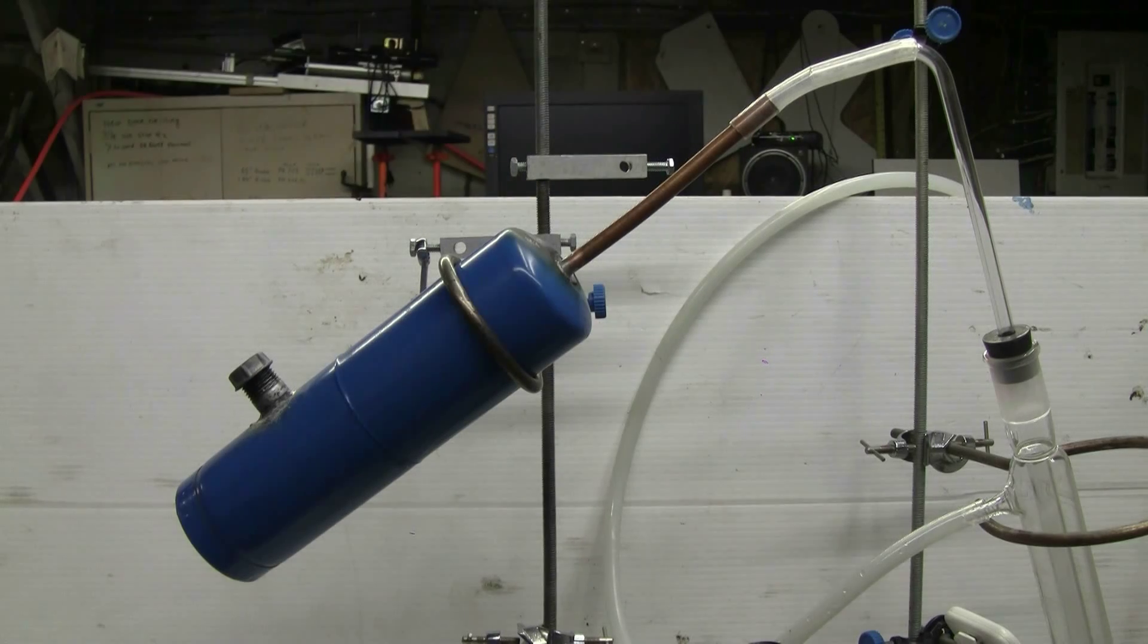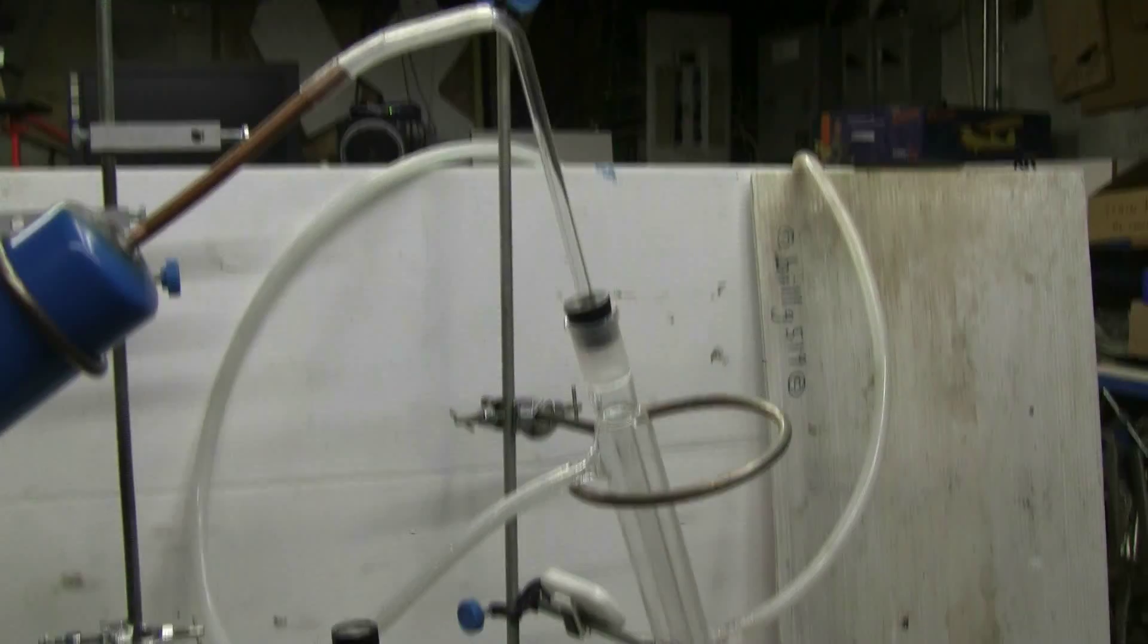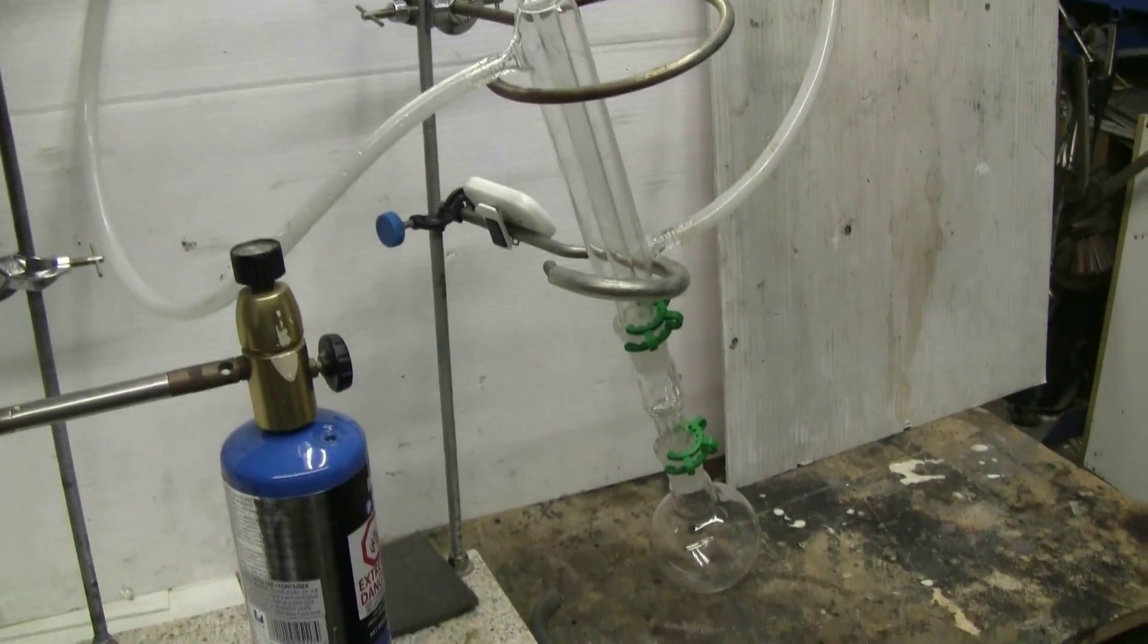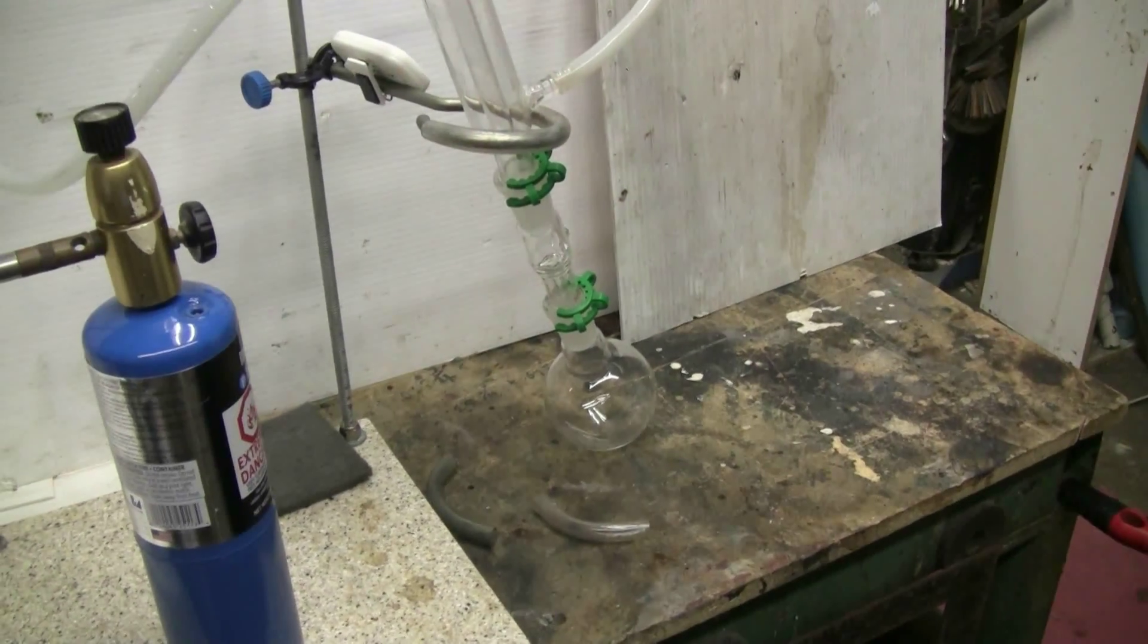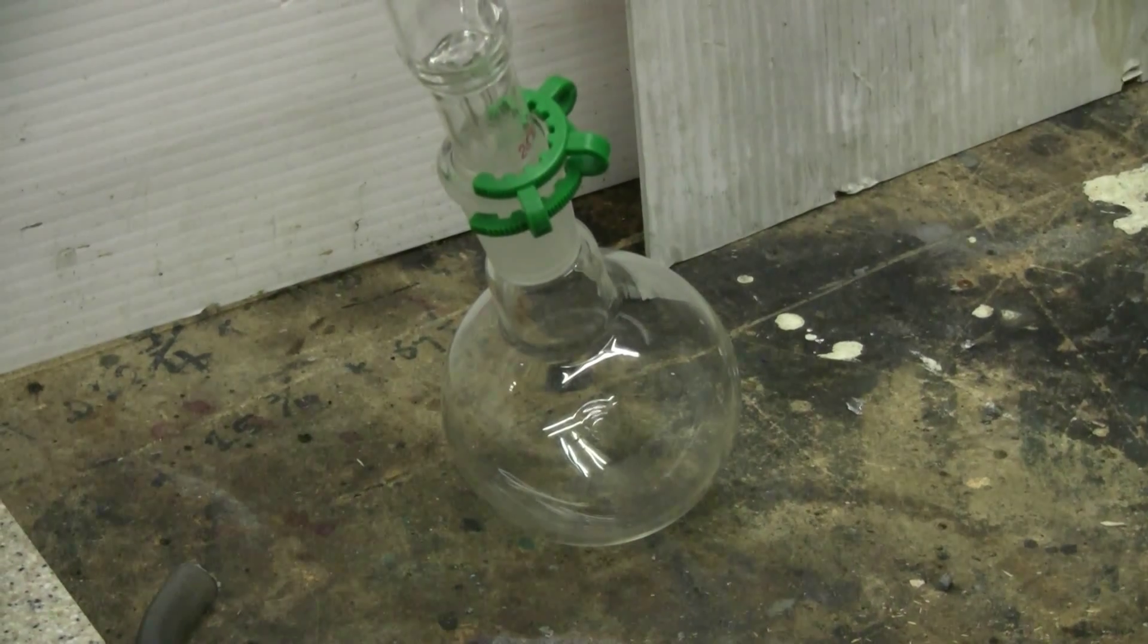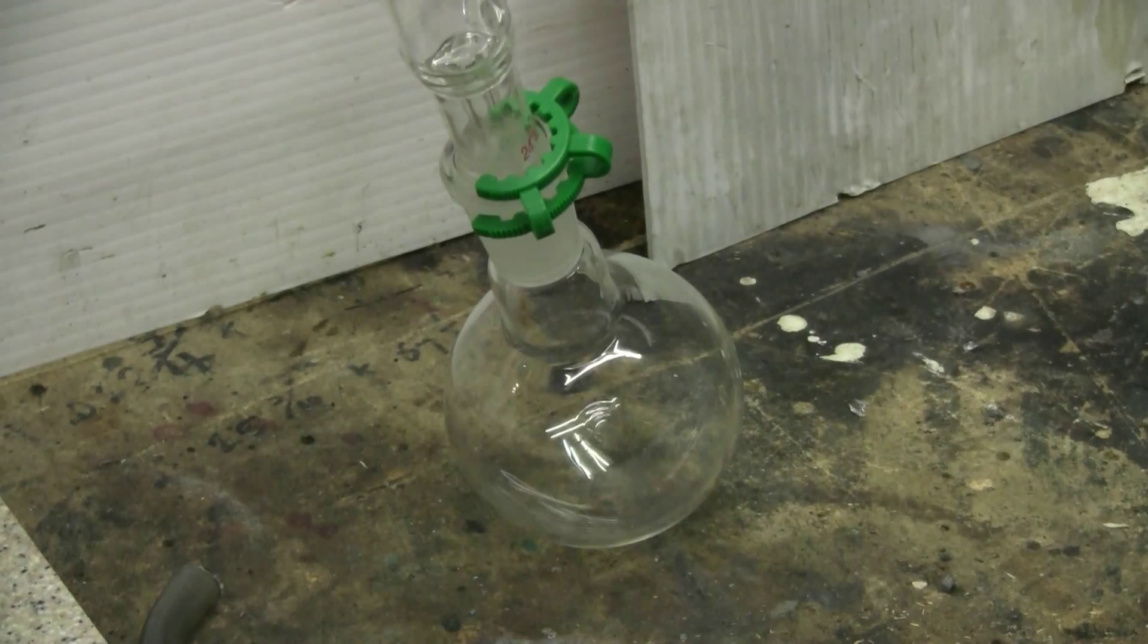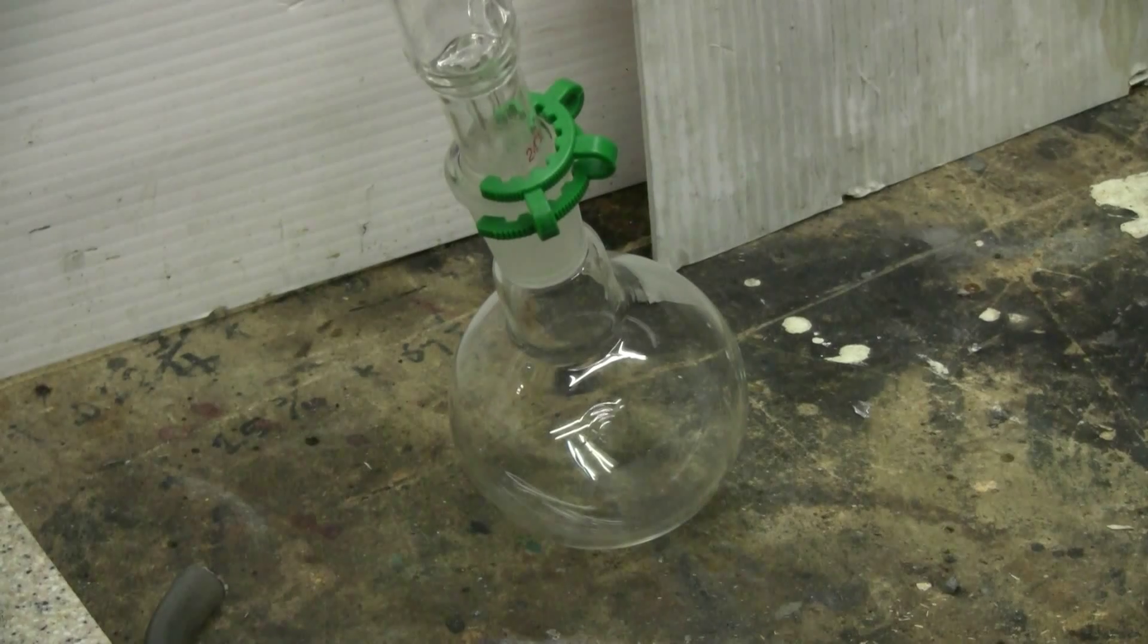Then I've put in a copper tube at the other end to allow the benzene vapors that I'm supposed to get from this reaction to come out and then go over and down into a standard glass water jacketed condenser. The benzene to be collected in this 250 milliliter round bottom flask that's going to be in an ice water bath to help keep things condensed.